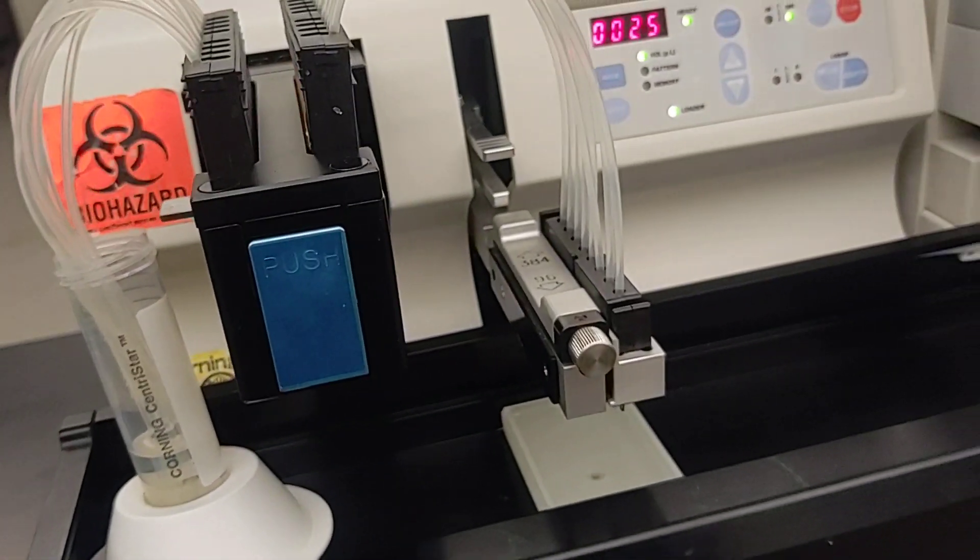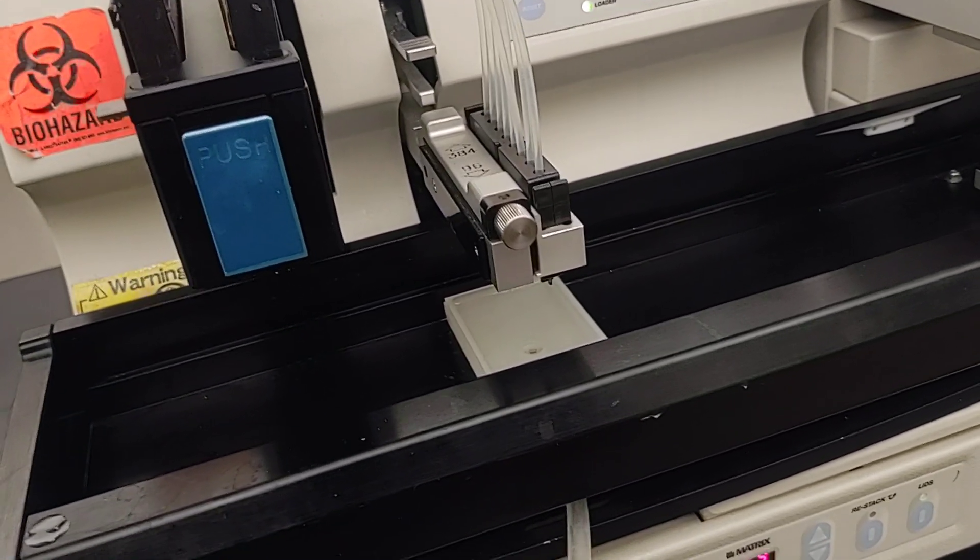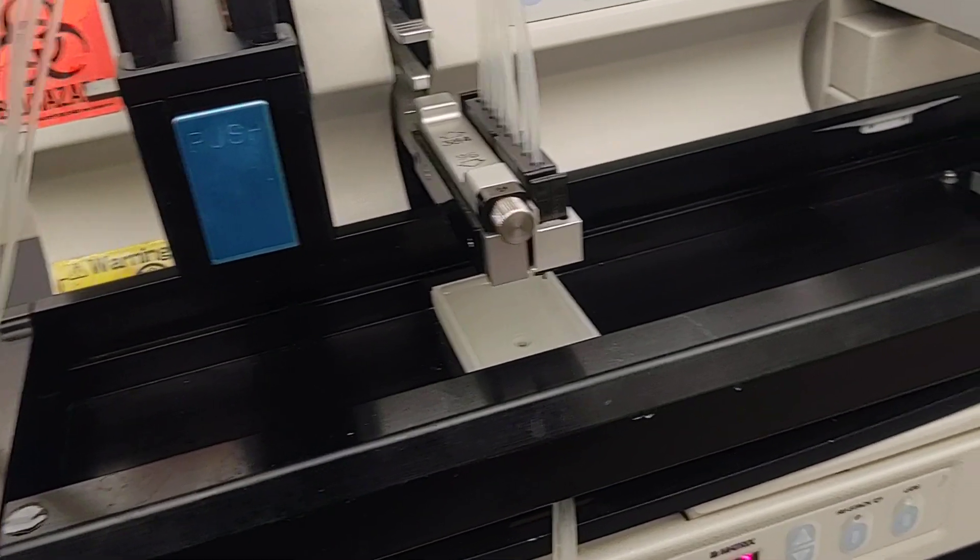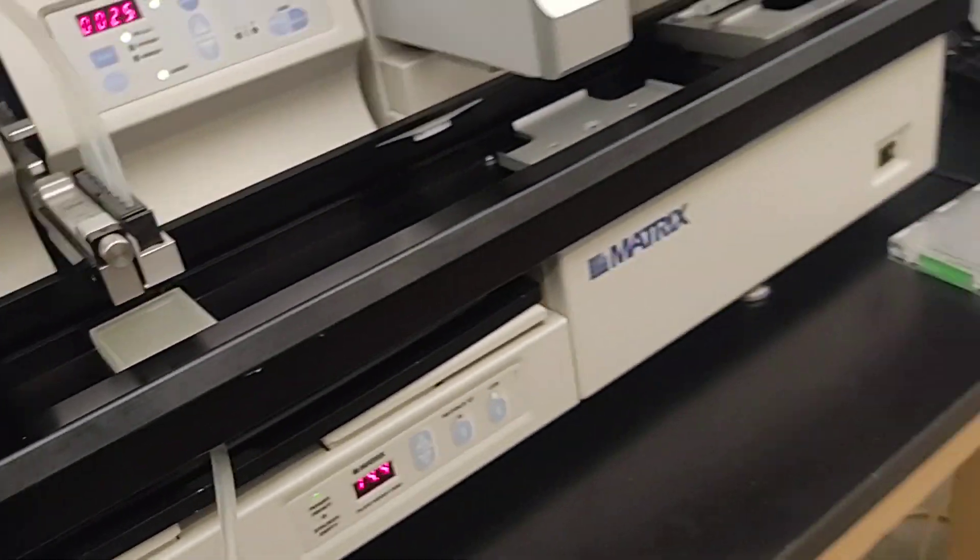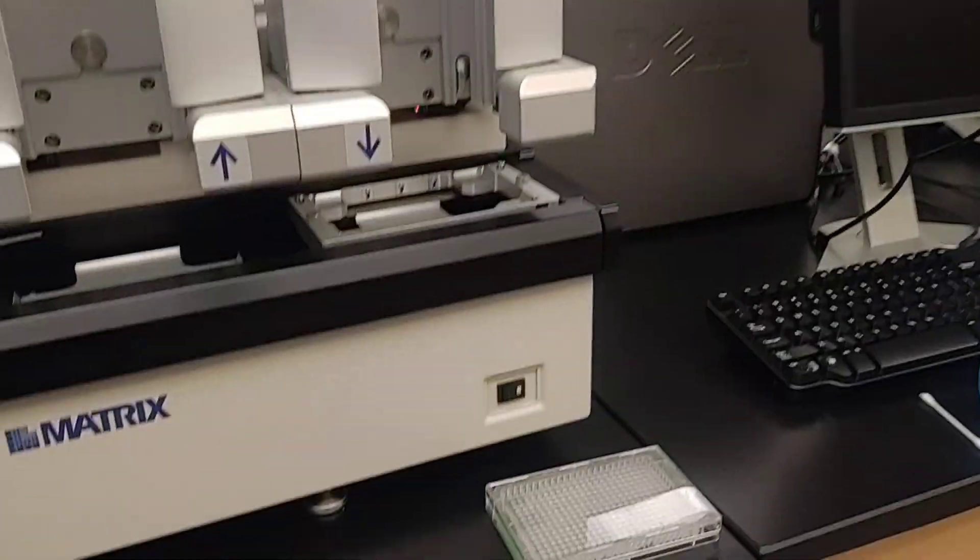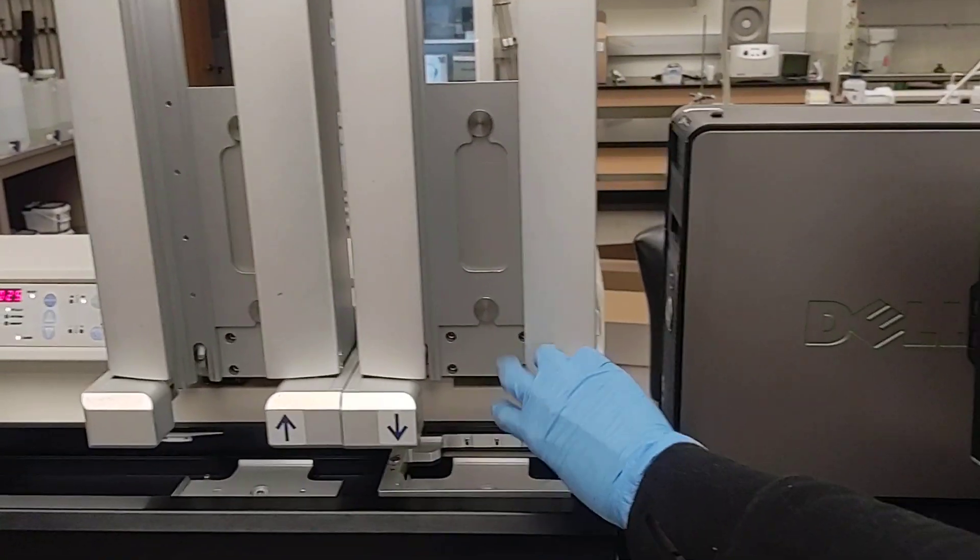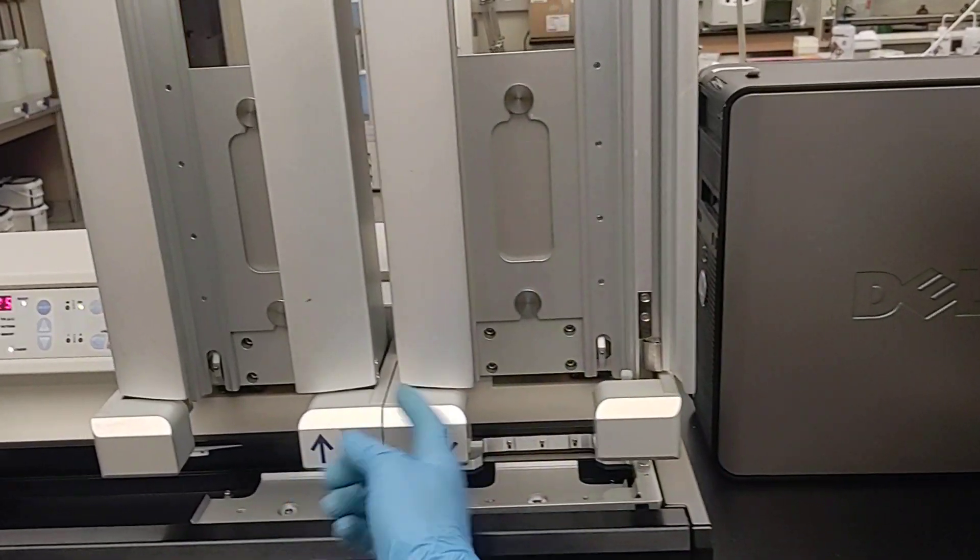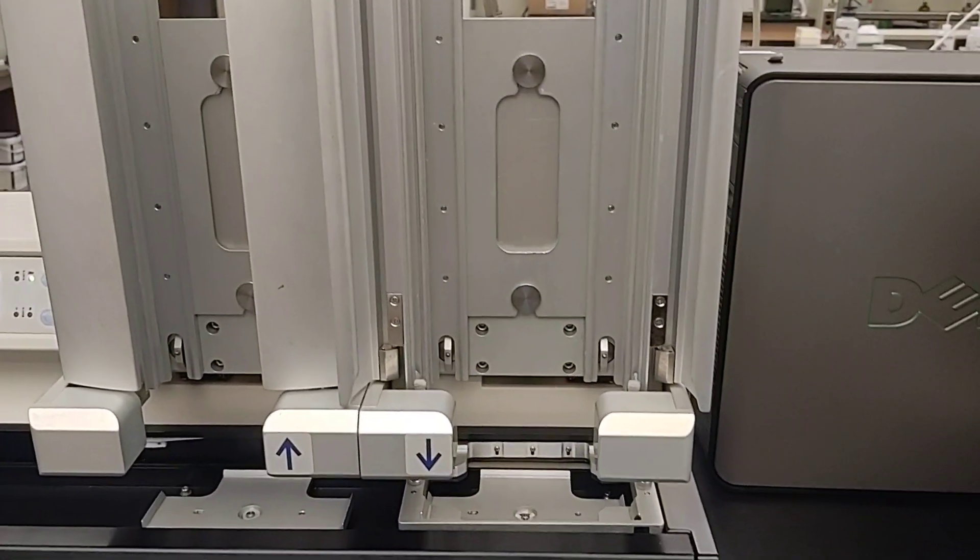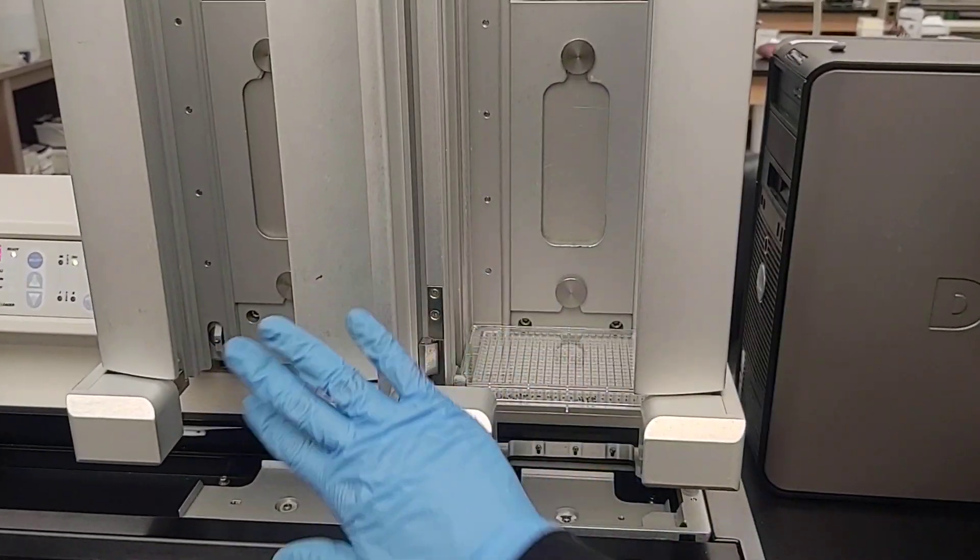Now that it's primed with our solution, we're ready to dispense into a plate. I'm just going to set this aside for now. Let me show you how to load the plate. So, these stackers, you just kind of lift this up and then open it. And then you can easily just put your plate into there and close them again.